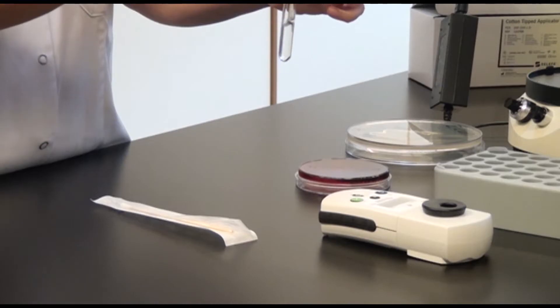The cotton swab is placed here and then into sterile salt water, where the bacteria are dissolved.